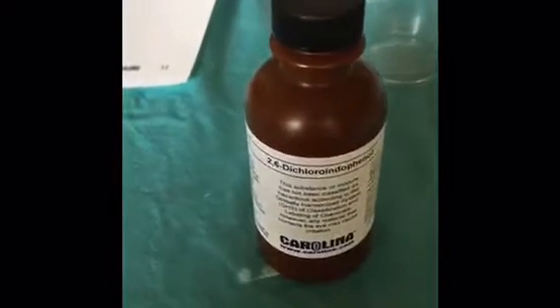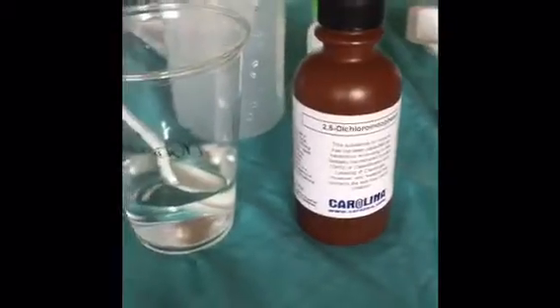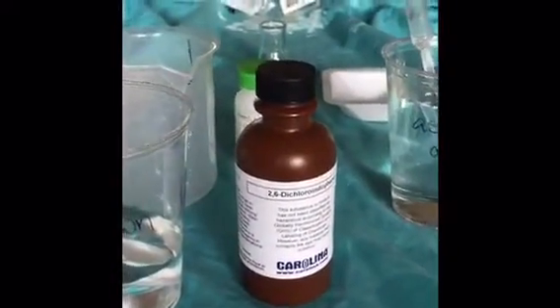Okay, I'm now going to prepare the 2,6-dichloroindophenol solution by adding 100 milliliters of water into it. I have shaken the solution, and now I'm ready to move on to activity 1, developing a standard curve.